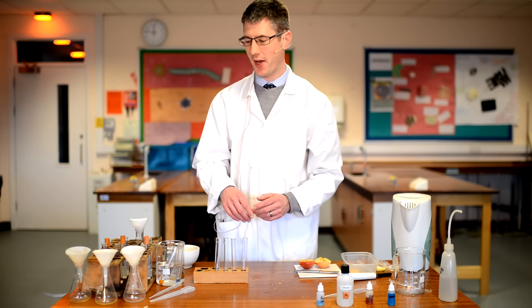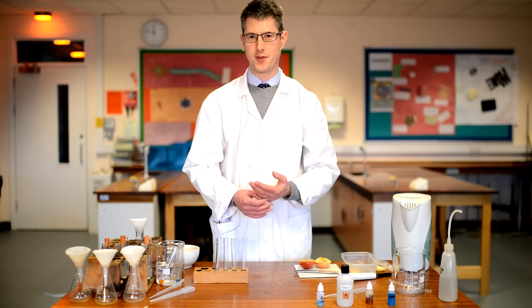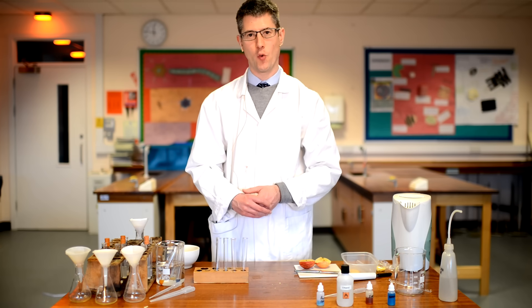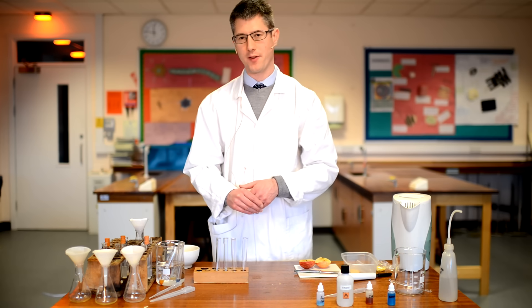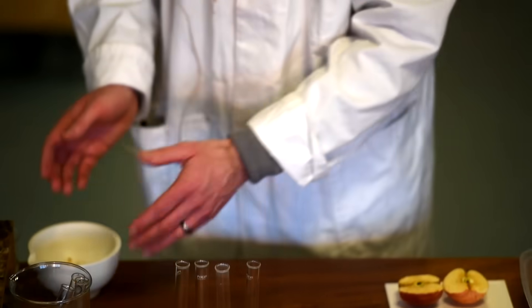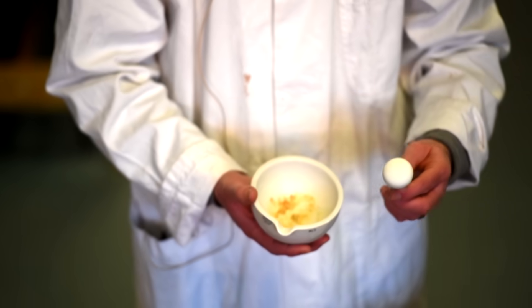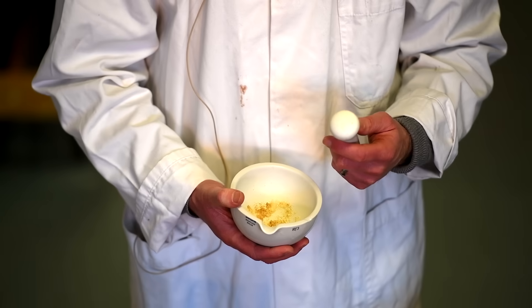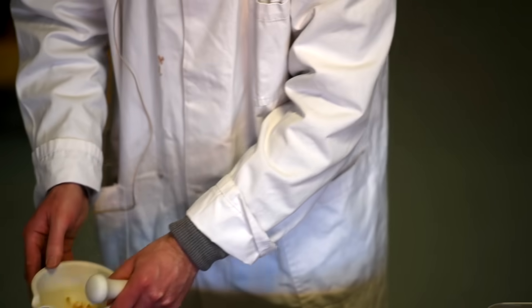I do have some samples that I've made earlier, so I'm now going to take you through how to do the four food tests using a pre-prepared sample. That is how you prepare all the samples — filtering the food out and collecting the fluid afterwards. I should also mention that once you've ground your biscuit up, the pestle and mortar needs to be cleaned, and you then use fresh glassware and a clean pestle and mortar to grind up and test your next food. You must make sure this is clean between experiments.